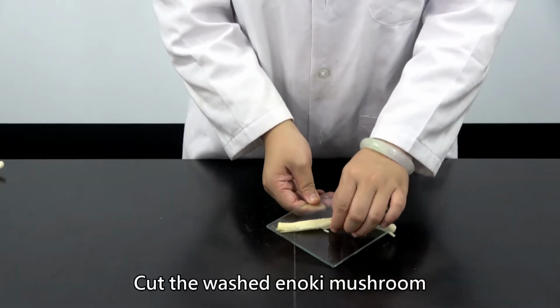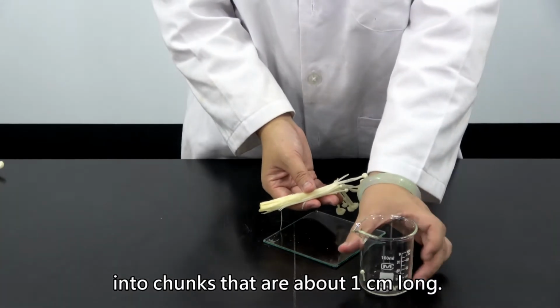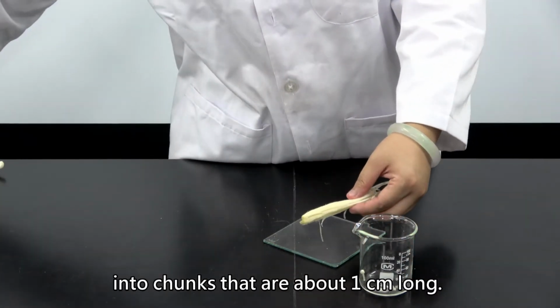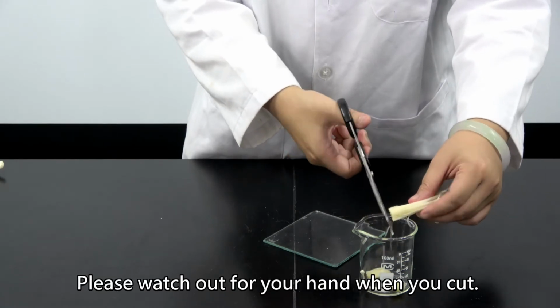Cut the washed enoki mushroom into chunks that are about 1 centimeter long. Please watch out for your hand when you cut.